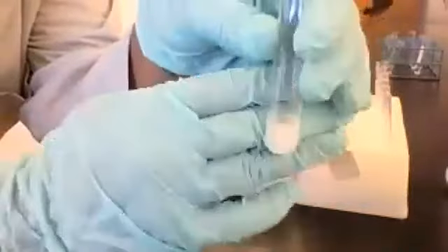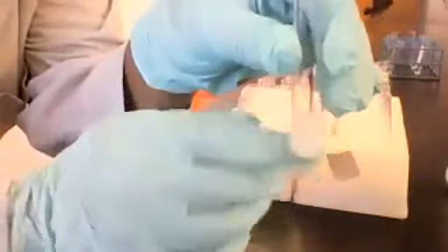those types of changes. In this one, you don't see any bubbling. There's no gas being formed. There's no odor coming from this. It's just a chemical change that's indicated by the precipitate. All right, let's go across that row.